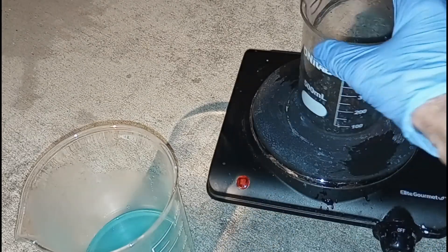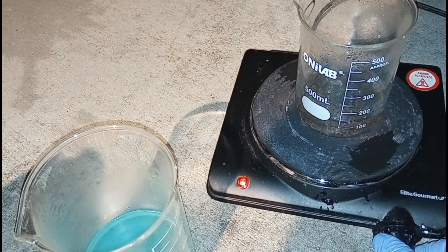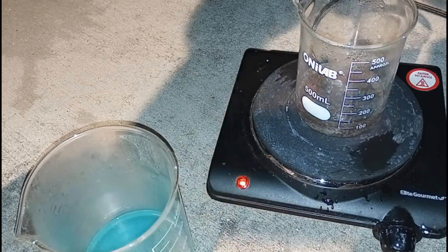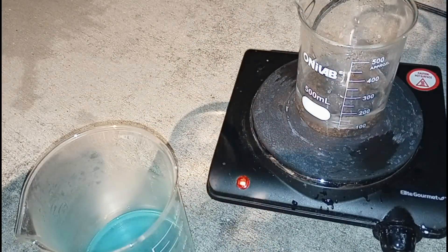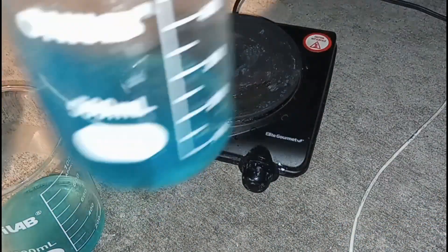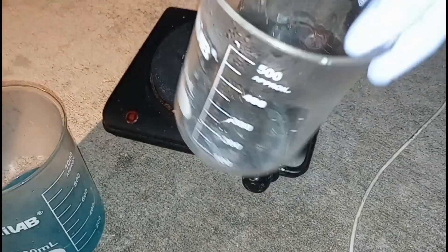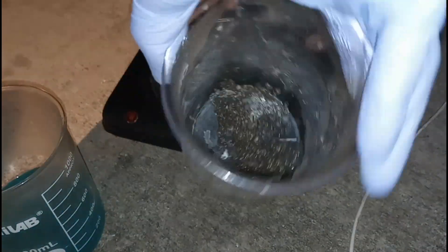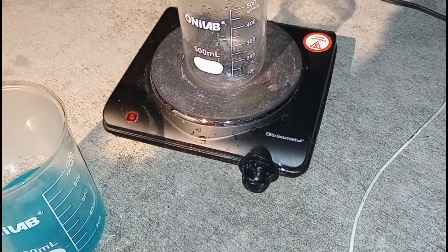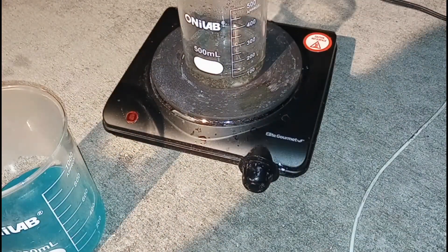These pieces don't look copper plated at all, which is a good thing. So now that we have that liquid off, we're going to add 100 milliliters of fresh vinegar and 50 more milliliters of fresh hydrogen peroxide. If this seems redundant I'm very sorry, but we're going to continue to do the same thing because it seems like it's working. We're going to take the liquid off while it's nice and blue, and then add another 100 milliliters of vinegar and another 50 milliliters of hydrogen peroxide.